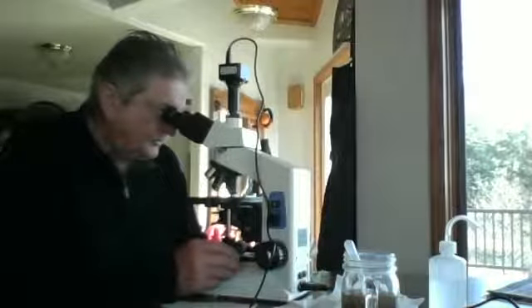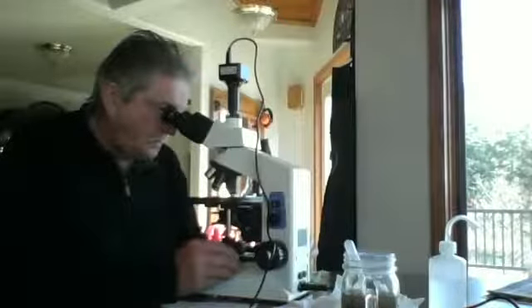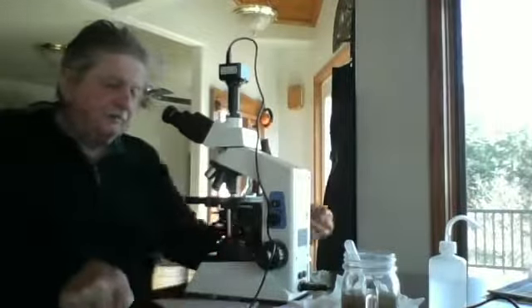No flagellates that I can make out. Whoop, there's one. Yeah. Fairly fast moving, but not that kind of speed that ciliates have. But rolling around seemingly aimlessly at times too. And I see 2 flagellates in field of view 1 and reading 5.